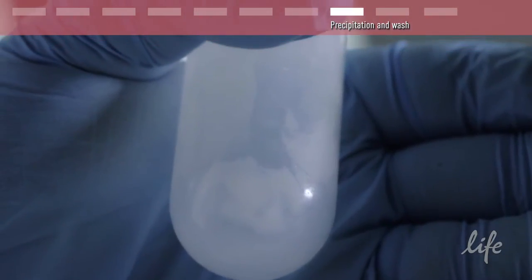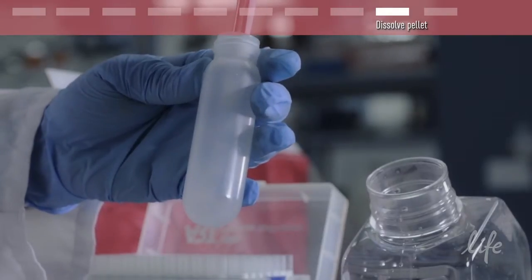Now that we have the plasmid DNA in a pellet, simply add either water or buffer to resuspend.